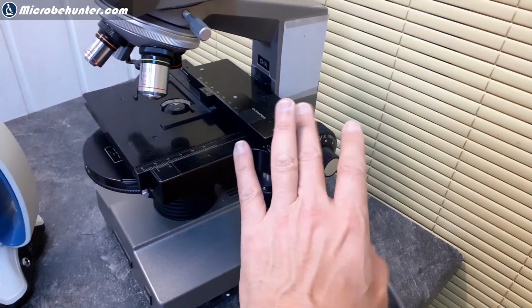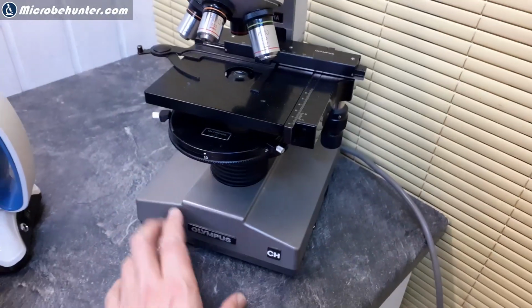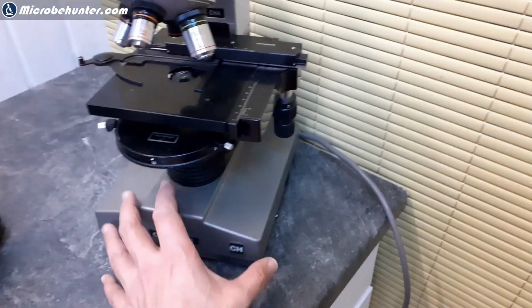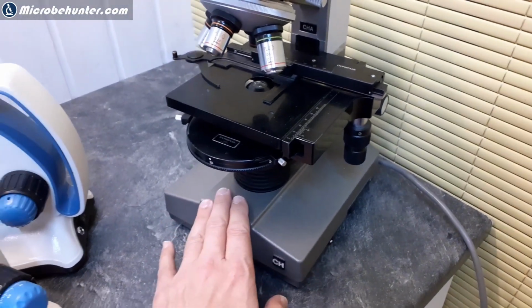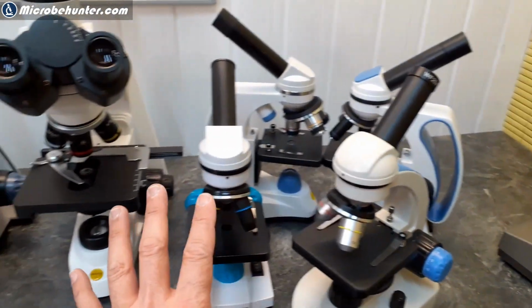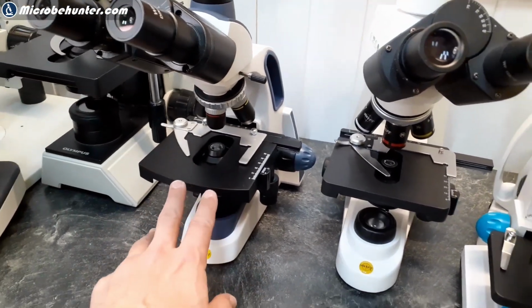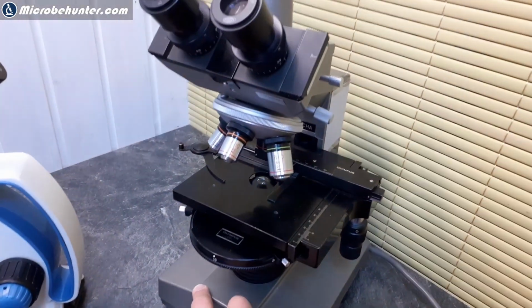So I took the microscope and gave it to an Olympus repair service company, because these are licensed companies, and I had to pay 200 euros just to get the microscope serviced. Can you imagine this? Just to get it serviced costs already more than twice as much as one of those introductory microscopes that you have here. And for about 300 to 400 euros, you already get a microscope like this. So why did I decide to do that? Because it's of extremely high quality.